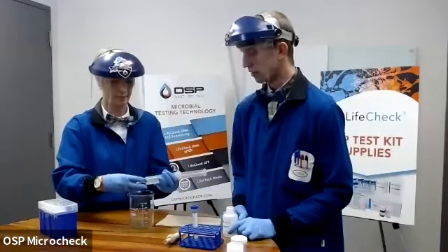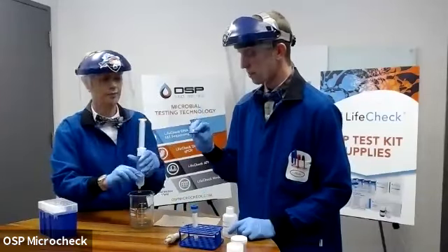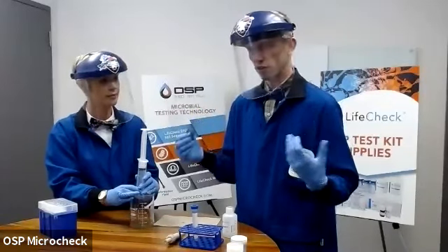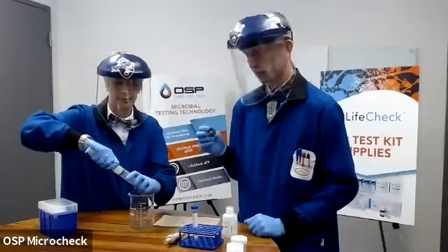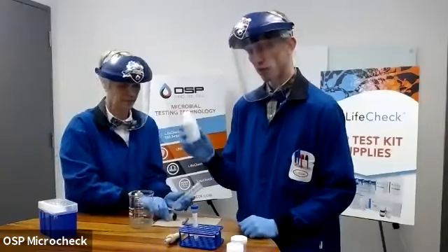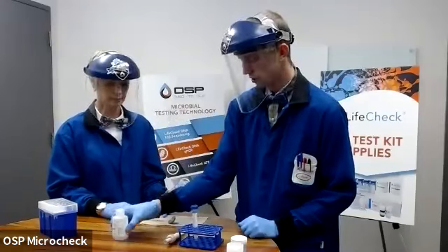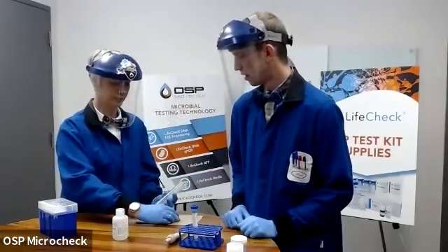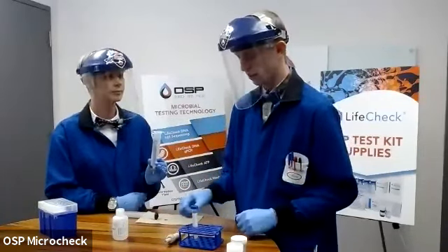All right, so now that we've cleaned those microbial cells captured on this filter membrane, the next step in the process is to crack open those microbial cells, releasing all of their cell innards, including those ATP biomolecules that we actually want to count and measure. So to do that cracking open of the cells, we're going to use our reagent X. And now this is a lysis agent, and we do want to add a specific volume of this to our filter syringe apparatus here so that we can take that into account in our calculations.